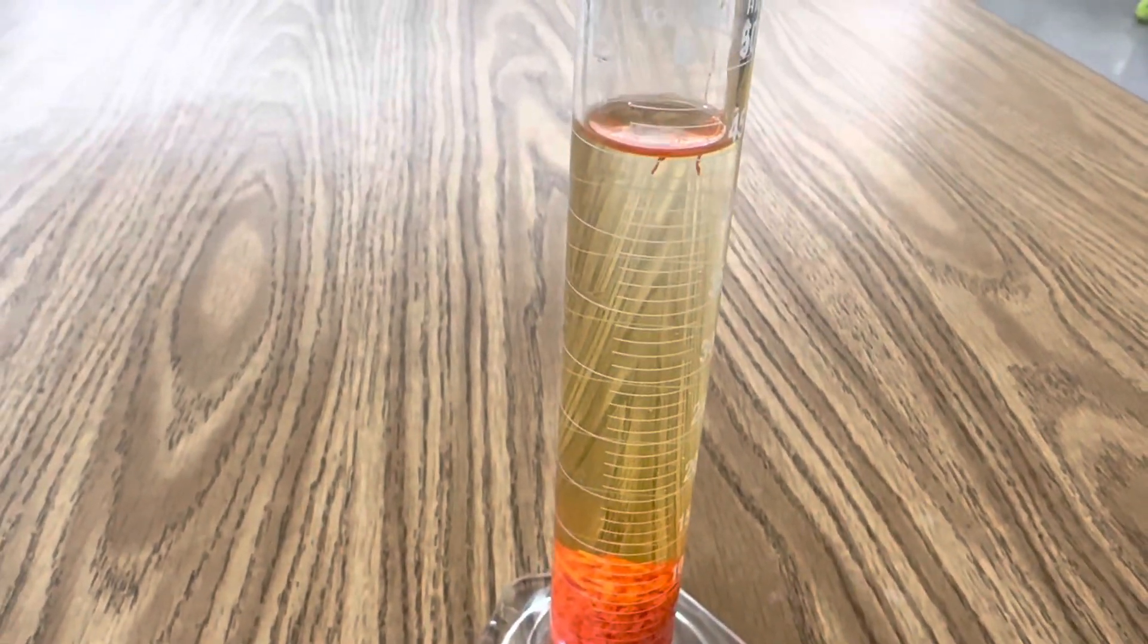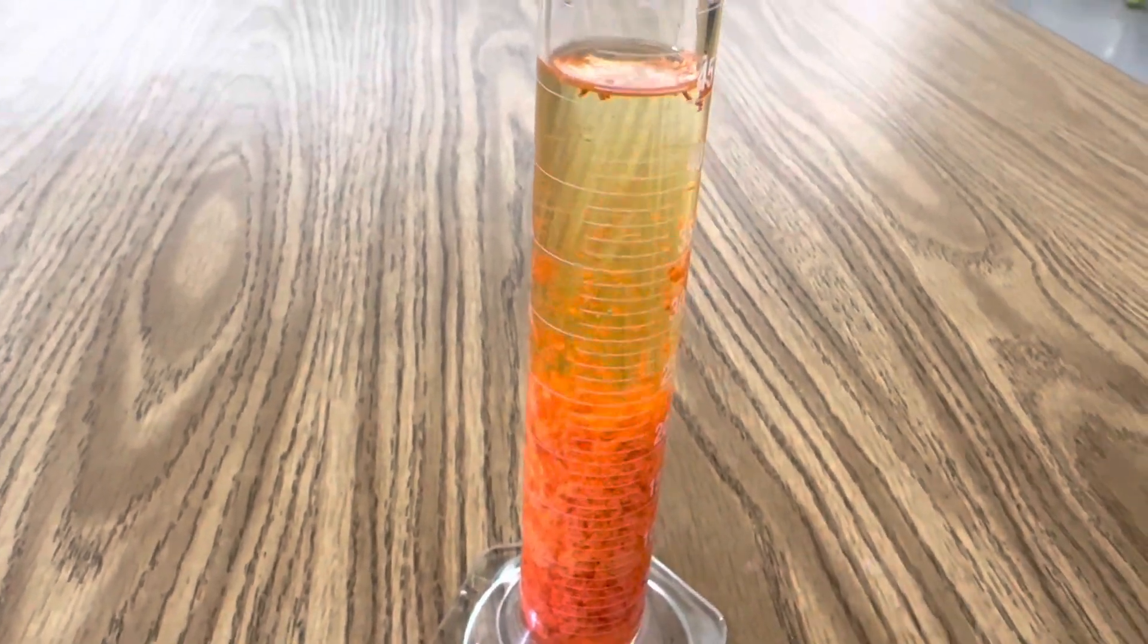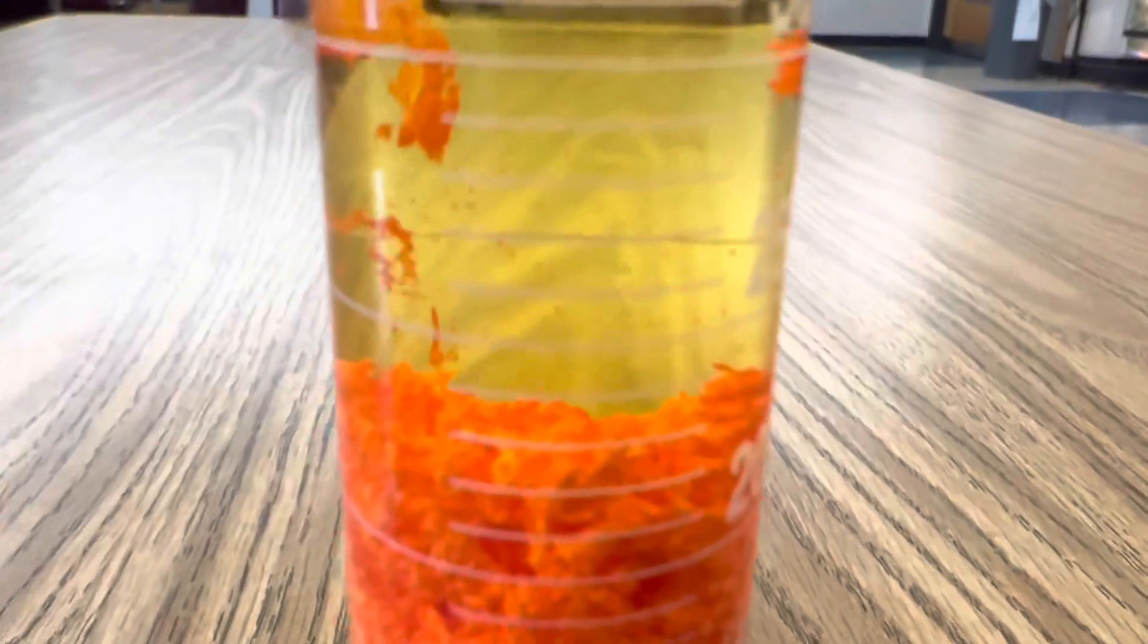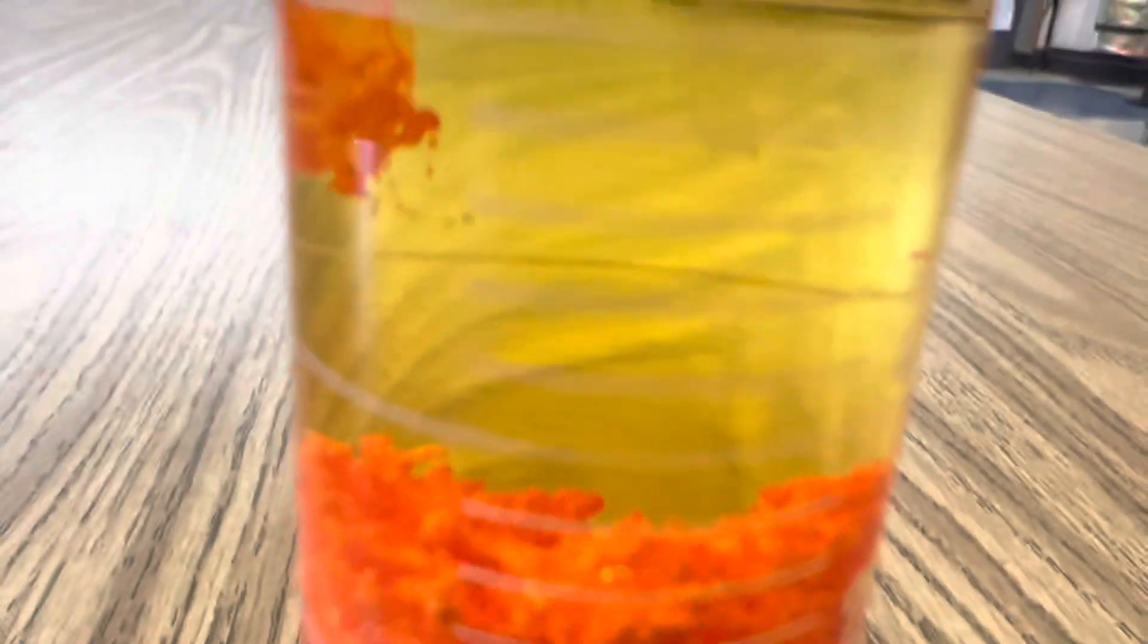Let's add just a little bit more. Oh that is awesome. Check out that precipitation. Just amazing. That is awesome.